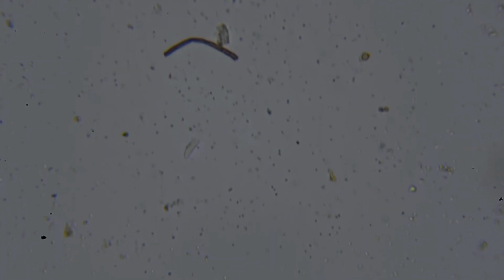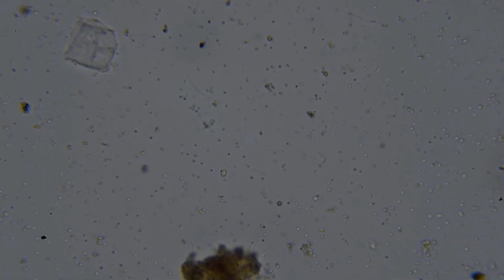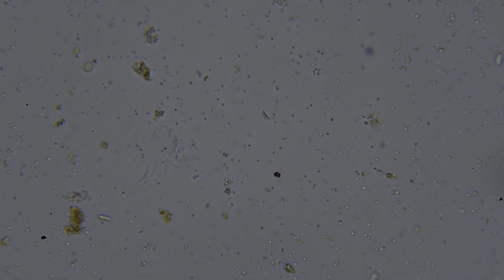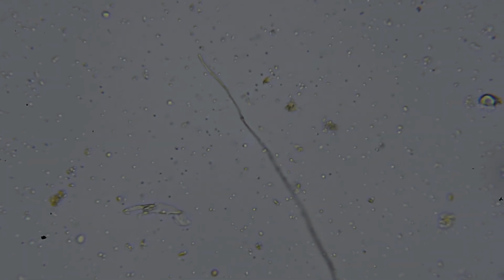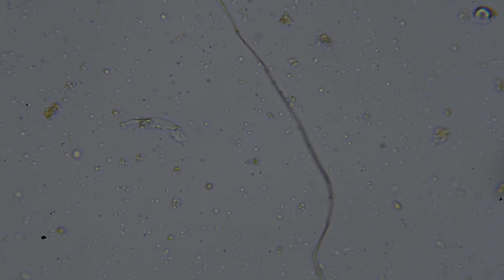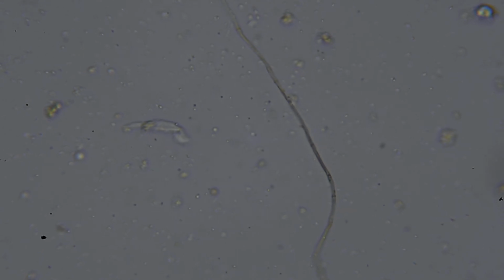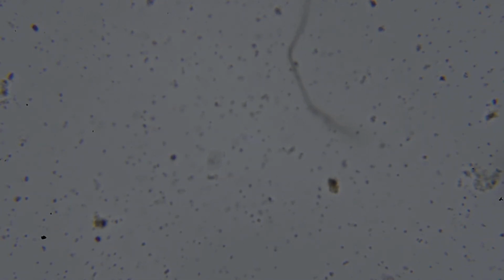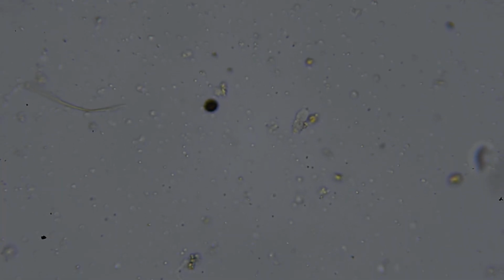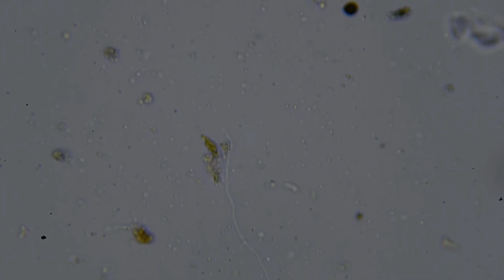That's another hyphae strand there that's broken off. Looks to be a really beneficial one. It's got a nice dark colour to it. Another aggregate there. We've got another fungal strand on the right hand side, which looks good. Yeah. We've got nice cross walls. It's clear and transparent, not so brilliant. It's also got a very narrow diameter, which is again an indicator of something that's not quite as beneficial, if you're talking about growing plants anyway.